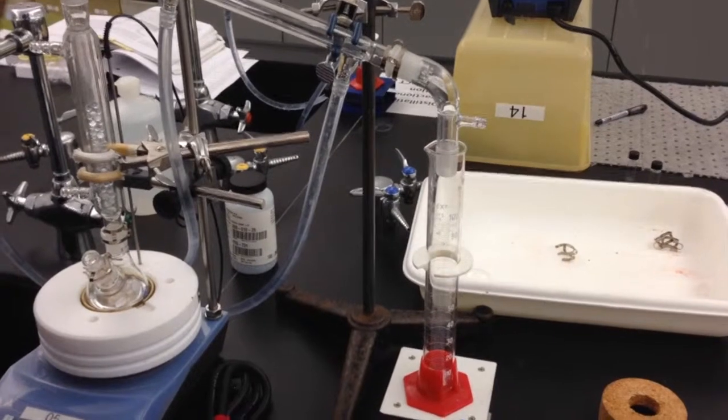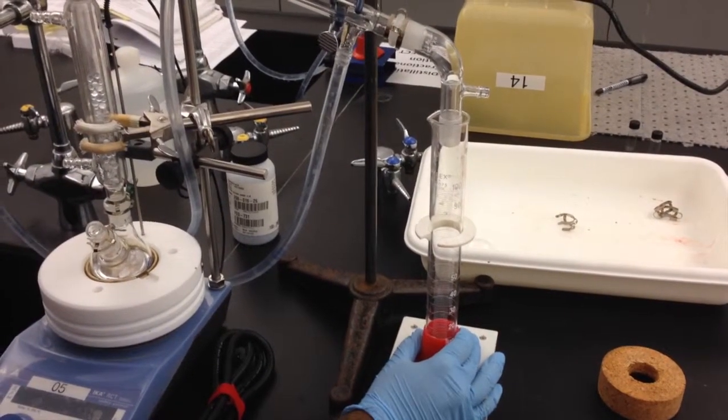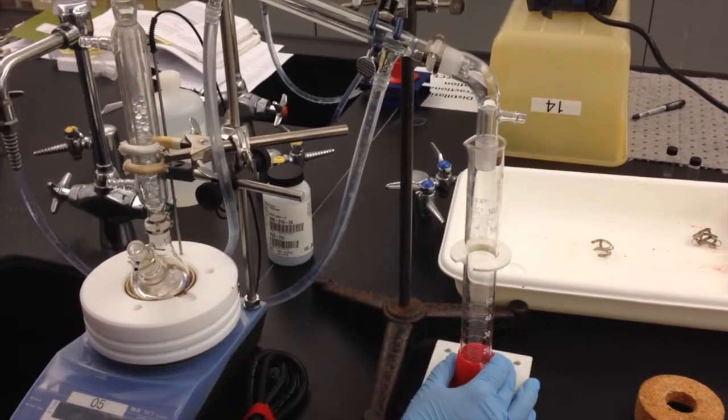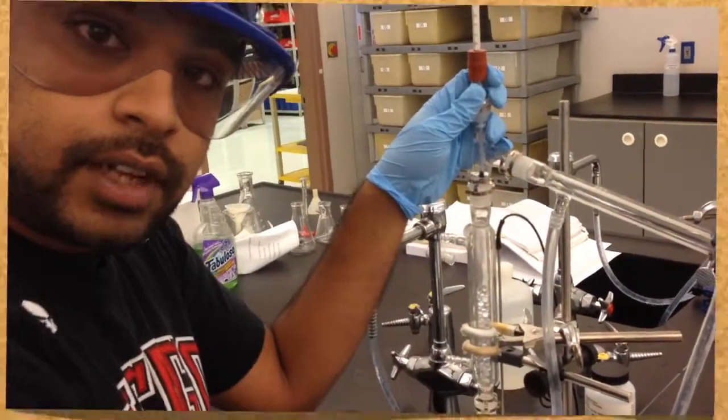So if we're running our cyclohexane-toluene equal molar solution, the first thing we should have is a much higher concentration of the cyclohexane. And after we run that, then we should have a very high concentration of toluene after we have evaporated all the cyclohexane out of the compound.